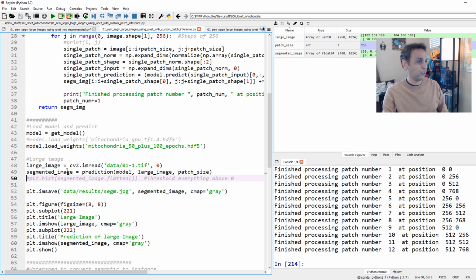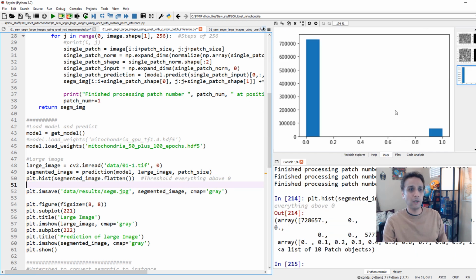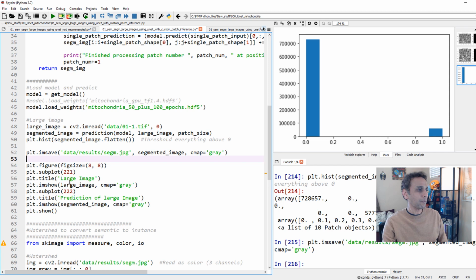Now, where are we? So we are done with our segmented image. We just need to go ahead and have a quick look at it. First of all, let's look at the histogram. This is a quick way of checking how my values look. So the background is all 0, and mitochondria, they all have a value of 1. So good check right there. And you can save the result. Let's go ahead and save it. I'm going to call this segment.jpg or segm.jpg.